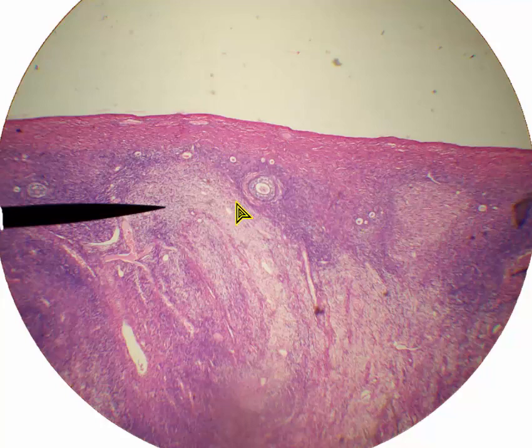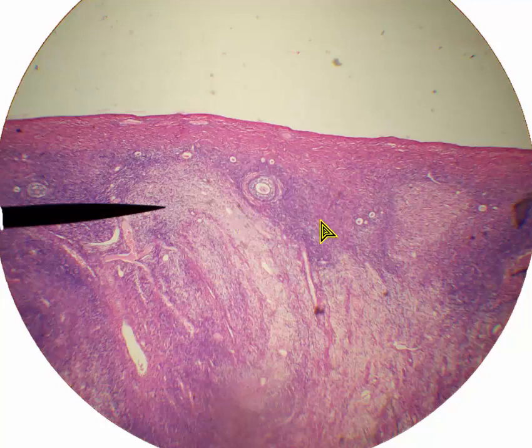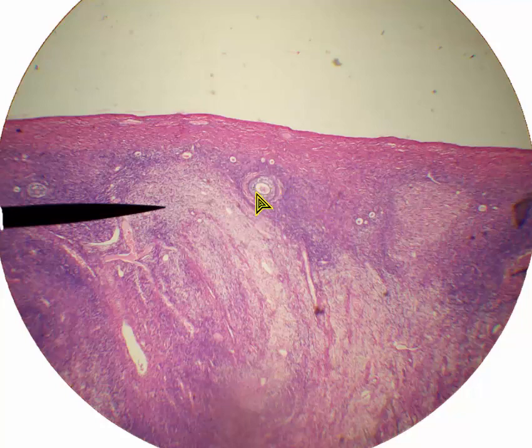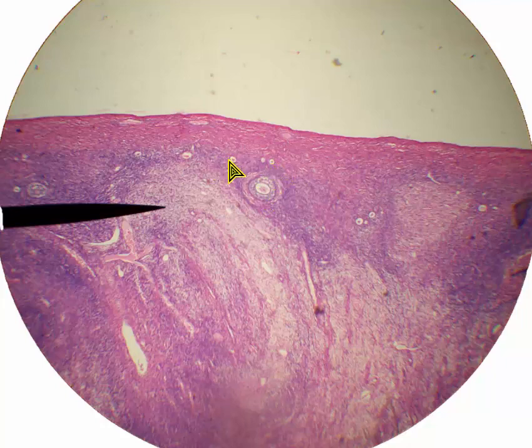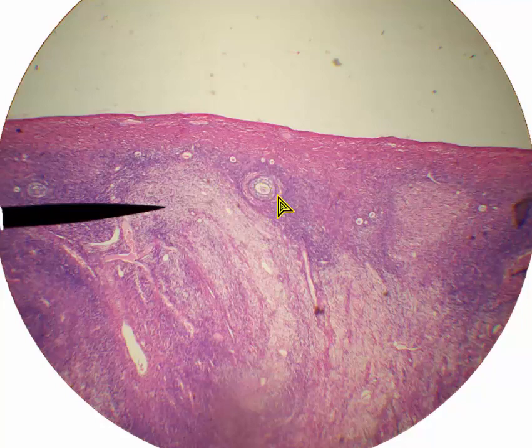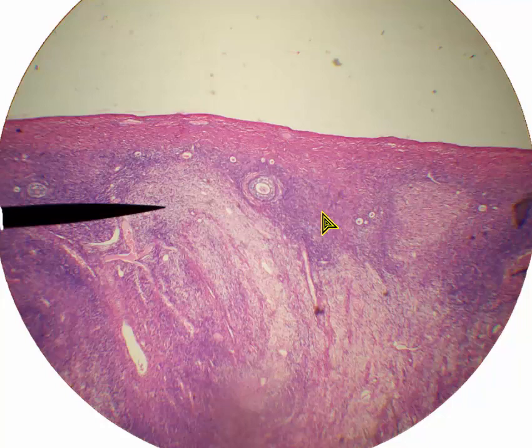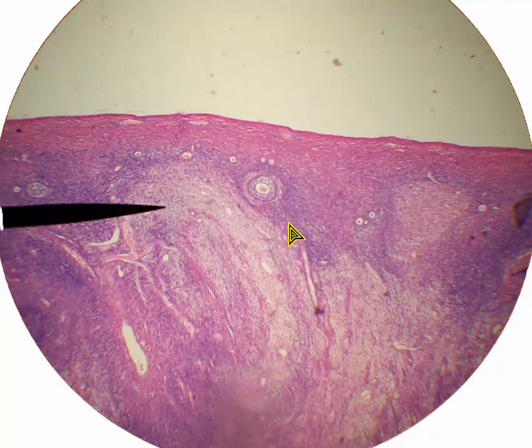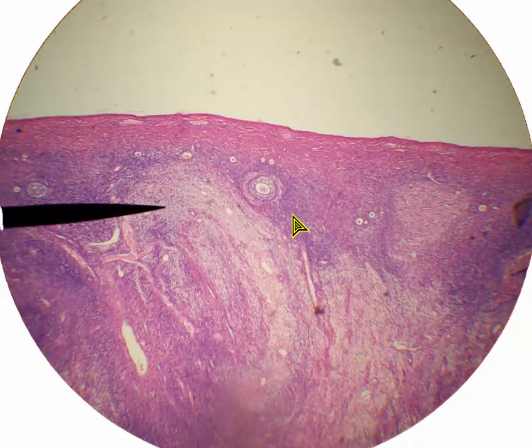In this first slide, what we're looking at at 40 times magnification is ovary. I can tell it's an ovary because of these circular structures — follicles. Separating the follicles is stroma tissue, like a connective tissue with blood vessels and such inside of it. It makes up most of the ovary. This is 40 times magnification.